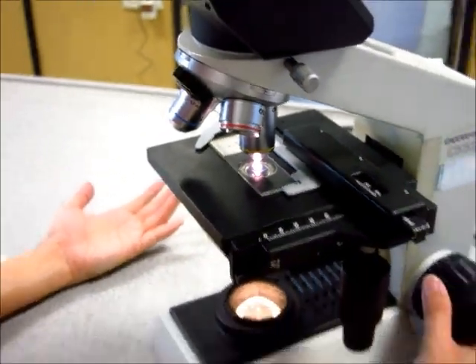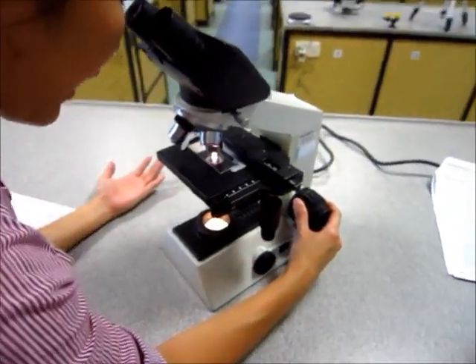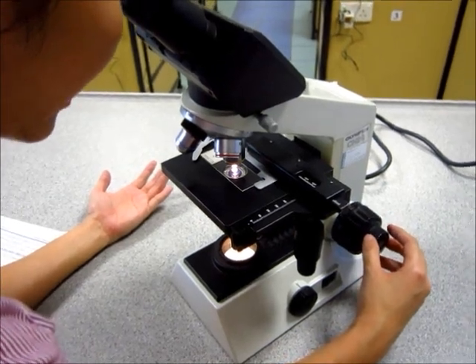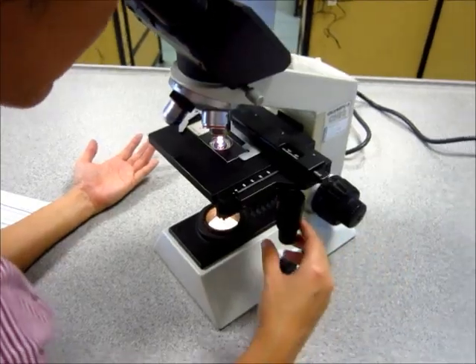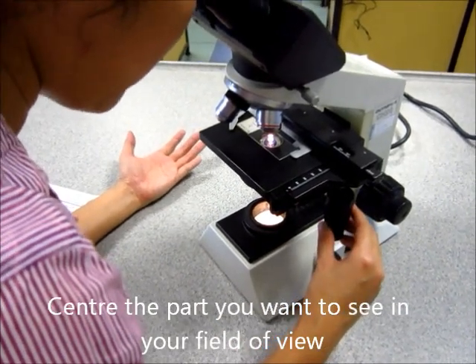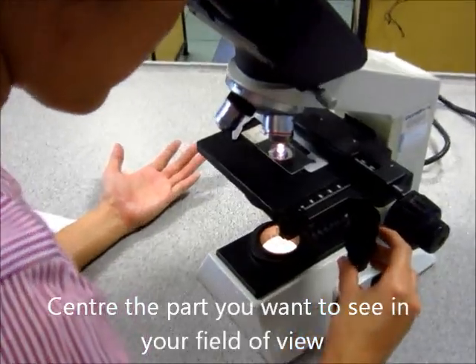Of course, you repeat the same process of adjusting your coarse adjustment and your fine adjustment until you can see a perfectly clear image. Again, sometimes you may need to adjust such that what you want to see is right in the middle of your field of vision, again using your vertical and your horizontal feed knobs.